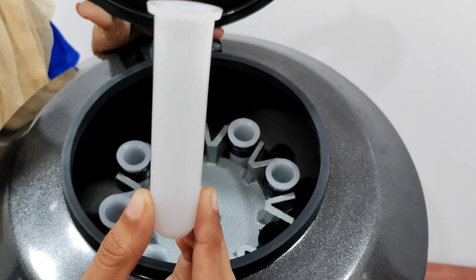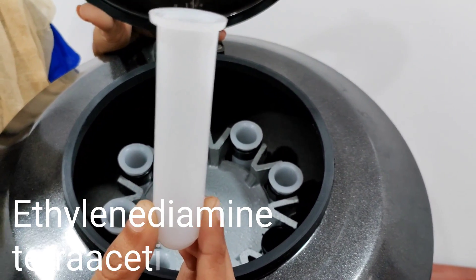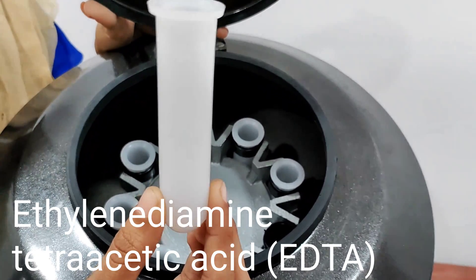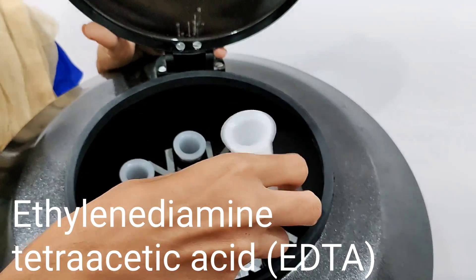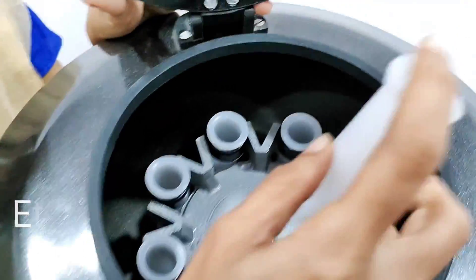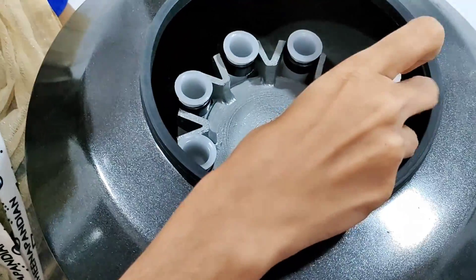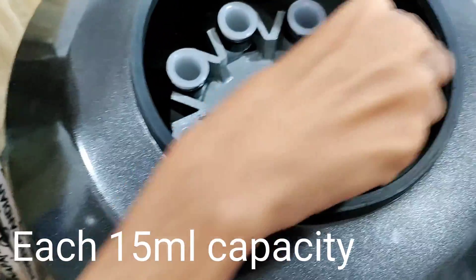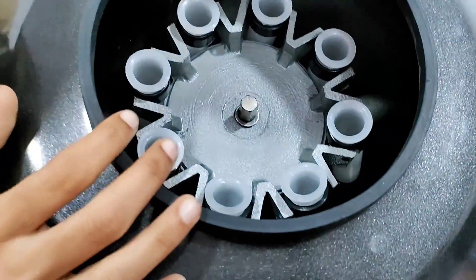For example, for plasma detection or analysis, we are going to use EDTA anticoagulant solution. I am going to place my vacutainer inside the holder. The capacity of the test tube is 15 ml. There are eight test tube holders present here.